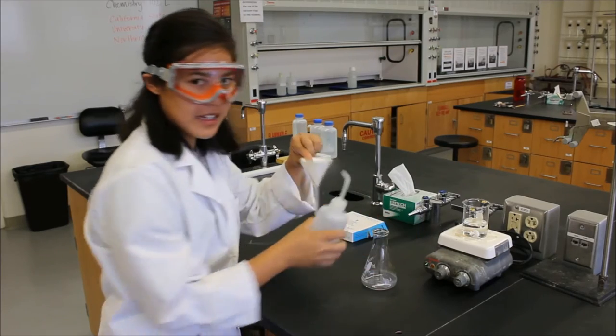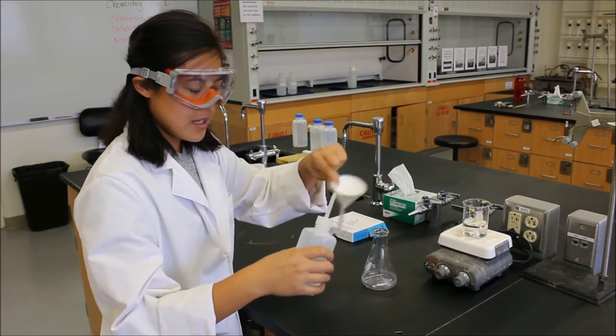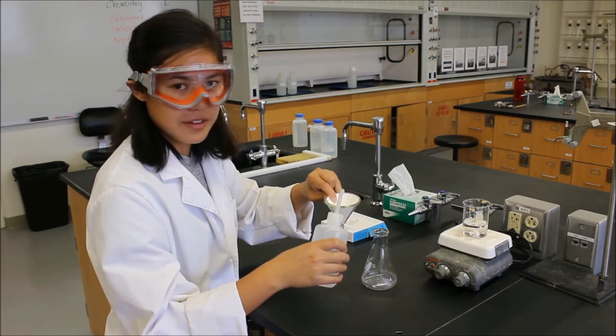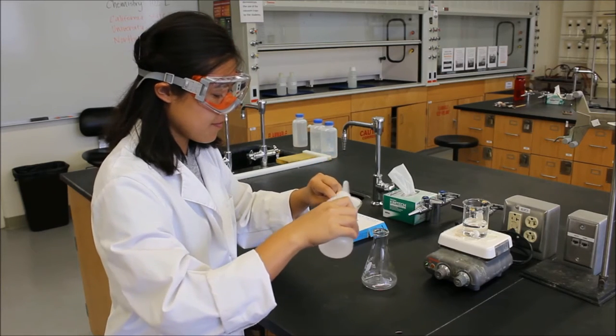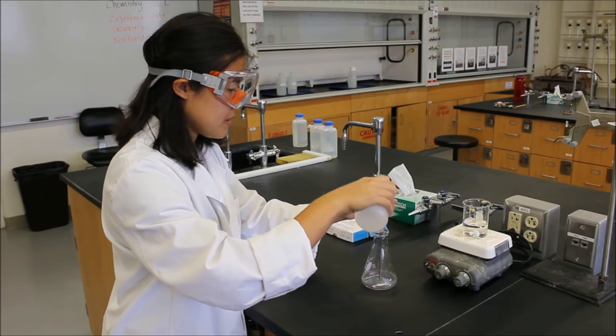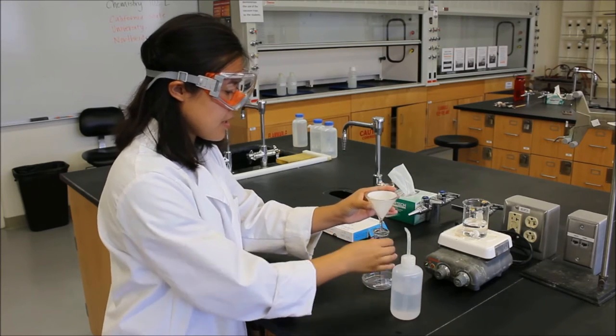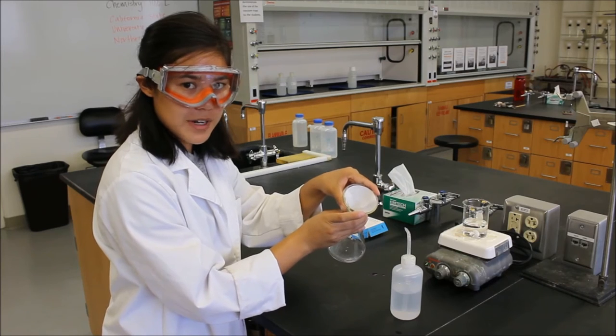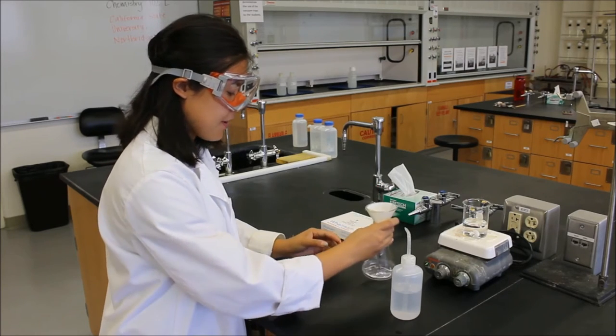We're going to want to wet the sides of this so that it sticks down. You don't want too much air gap in here or else it's going to slow down the flow when you're trying to filter your stuff. And so now that it's all wet, your filter is ready to go for all your filtering needs.